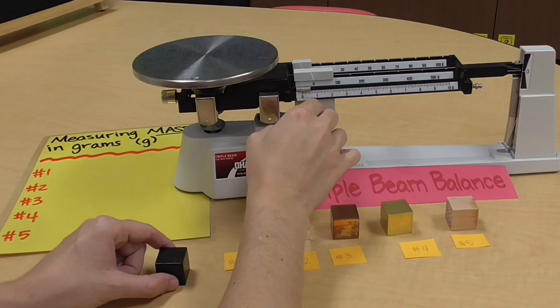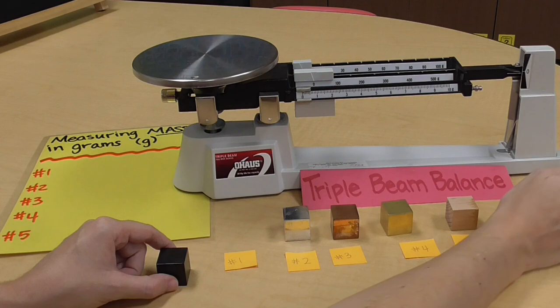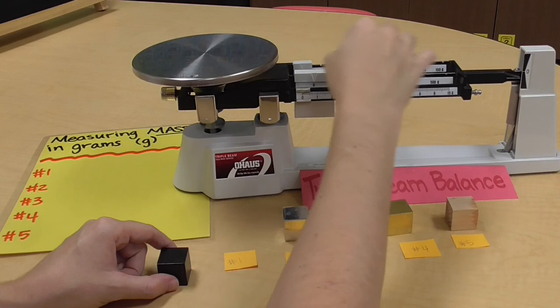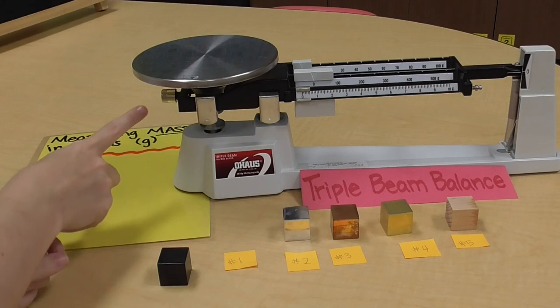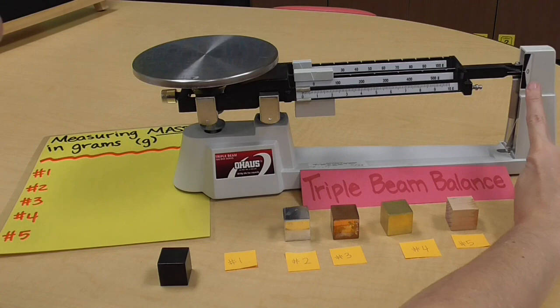It might take me a little while for it to balance out with a triple beam balance. You have to be very patient and you have to wait for it to get to zero. If you see it's not at zero, you can come over here to the adjust knob right over here and you can adjust it ever so slightly and again, wait for it to just be still. Is it at the zero mark? And there we go. So, we're good to go.